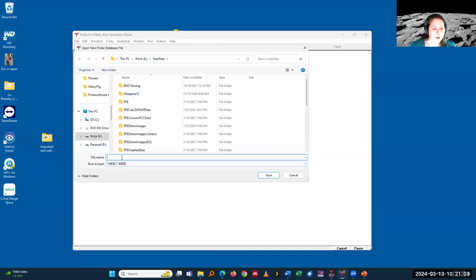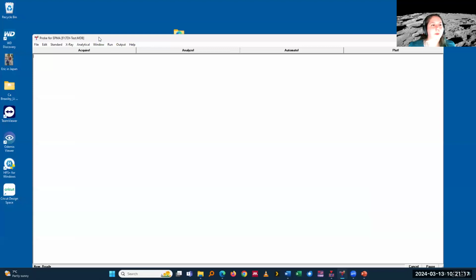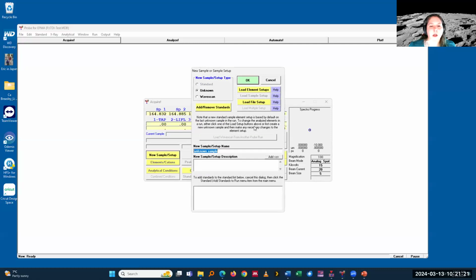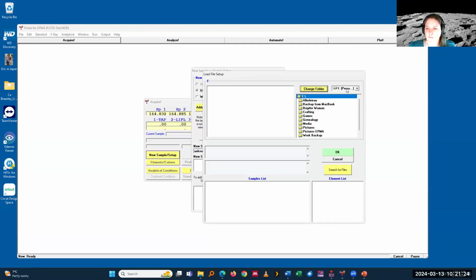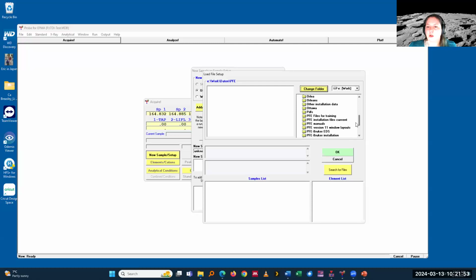We can just make a TDI test new. Oh, yeah, okay. Well, let's save it somewhere else. File, and then I can load in an existing file. I can load in a setup from a different folder, from a different file. And okay, so let's go here and do that.